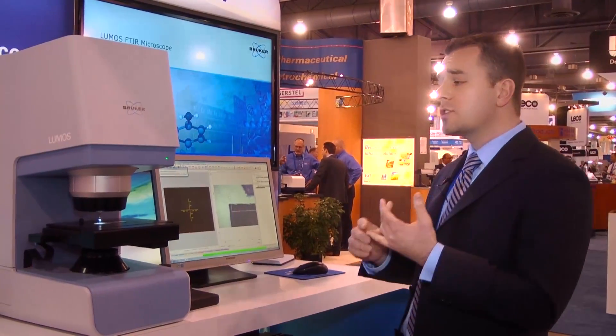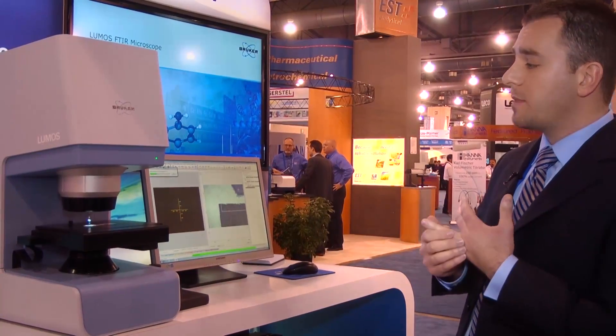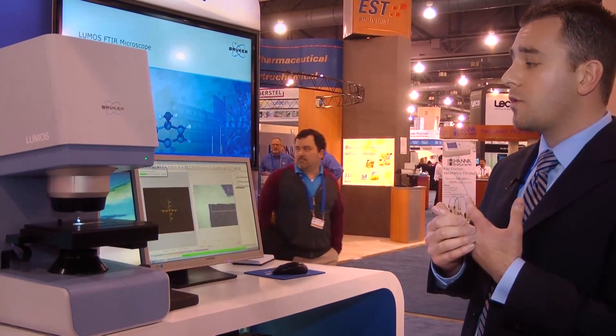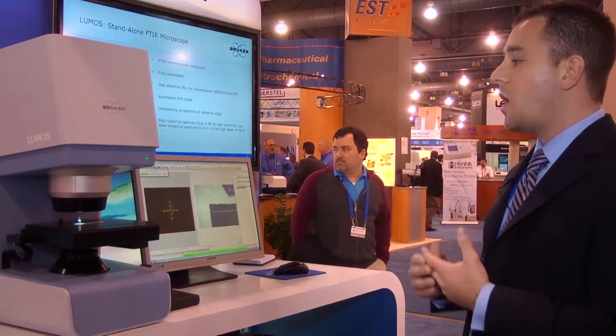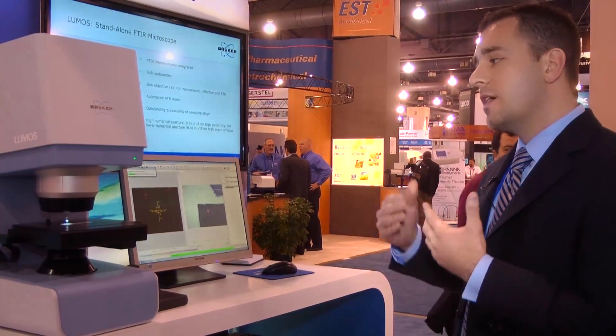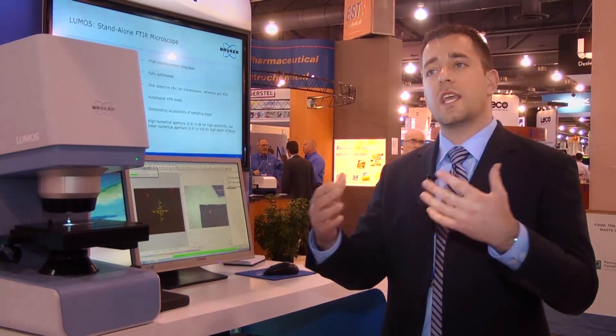We have the automated ATR, automated condenser, automated polarizers, automated XYZ stage, and also the automated numerical aperture change.